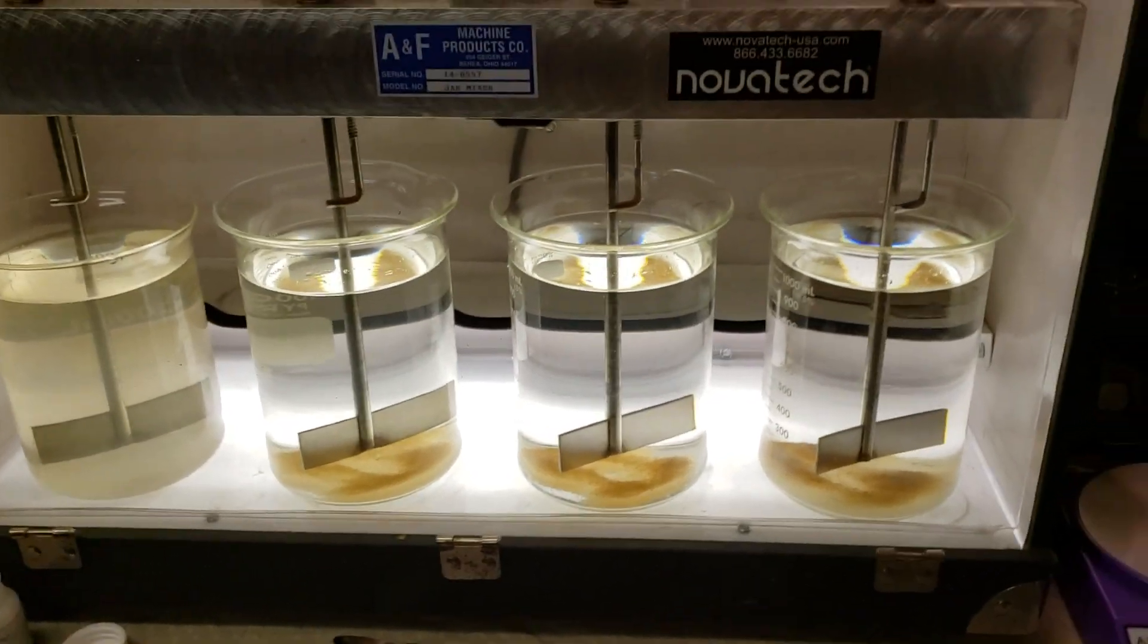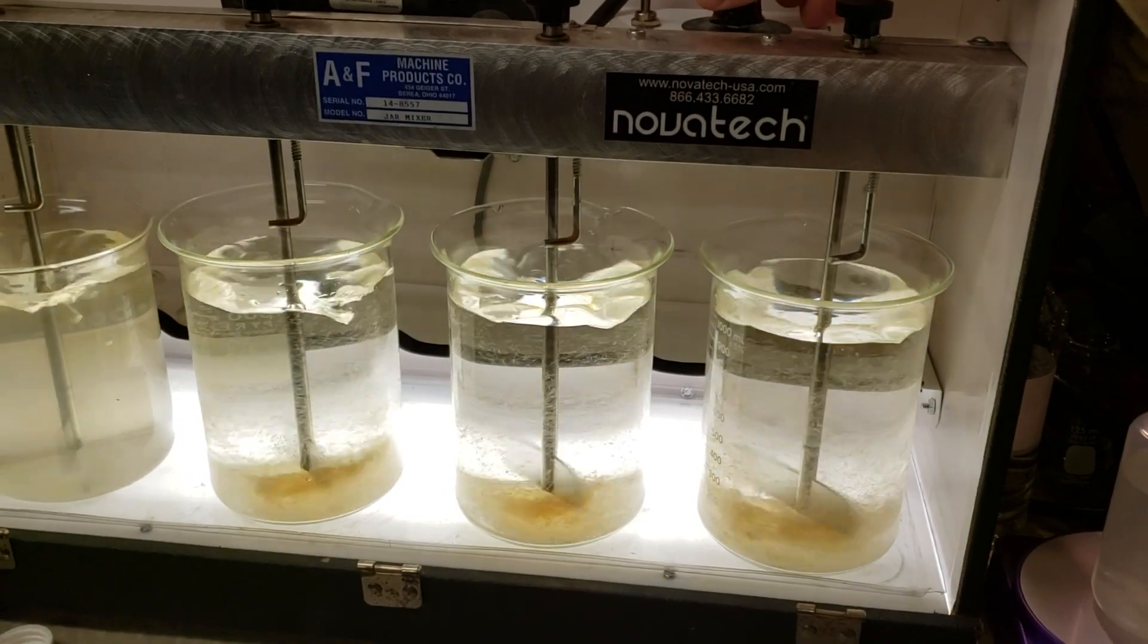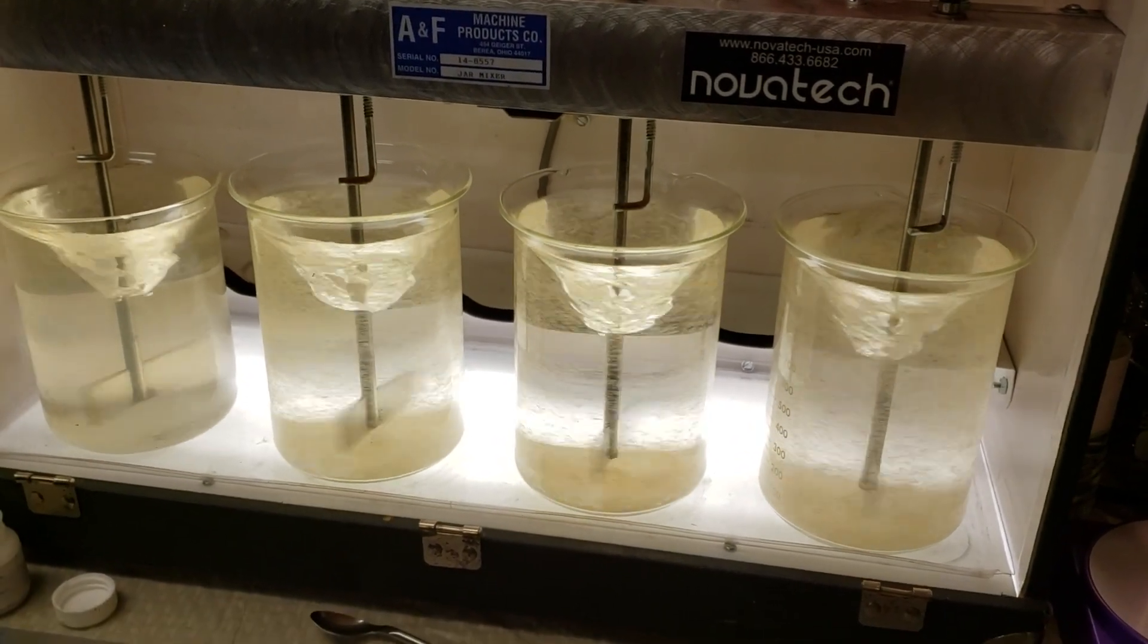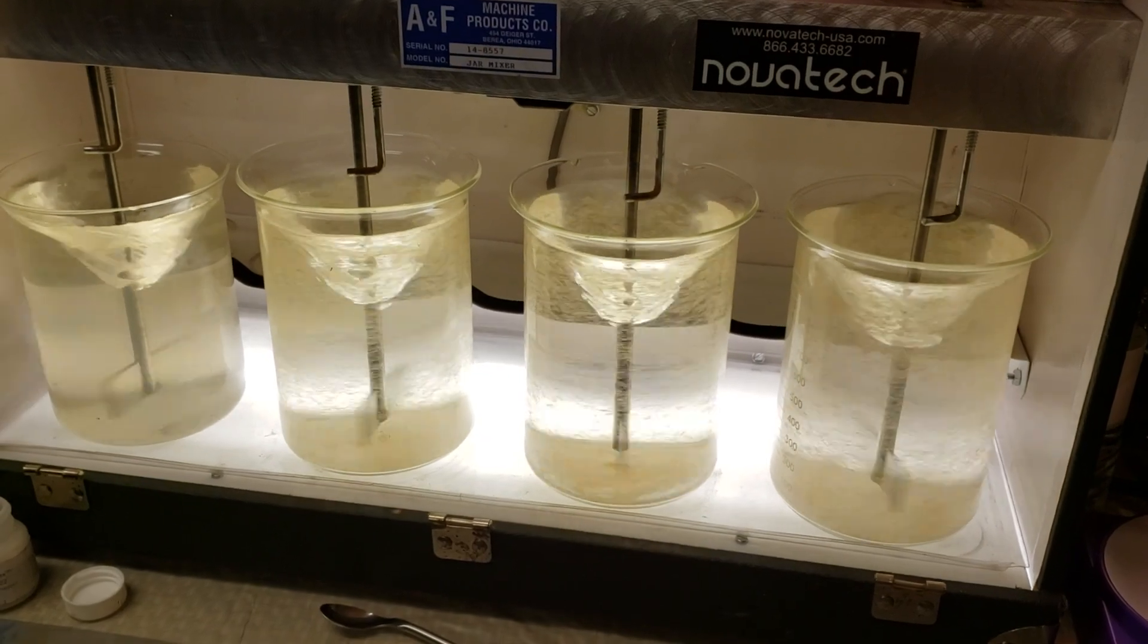All right, we'll turn it on again just for effect. We'll turn it off.